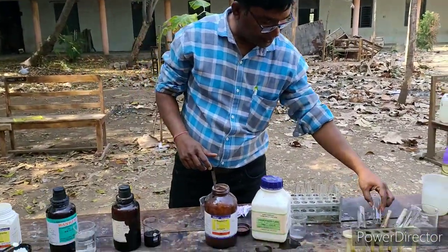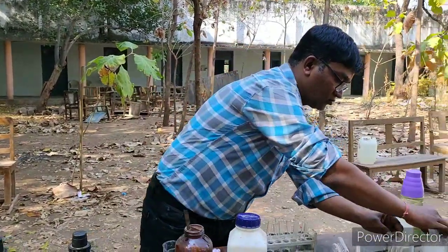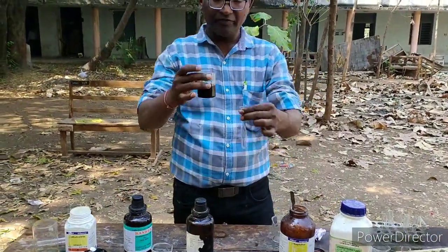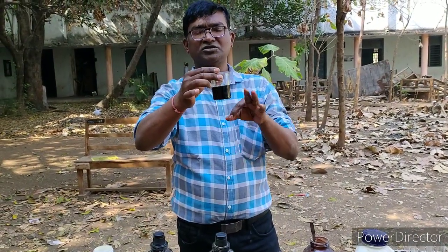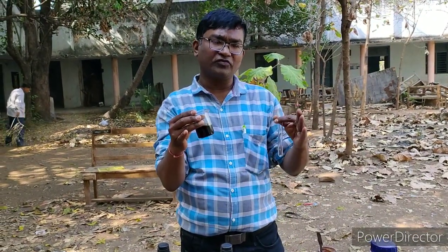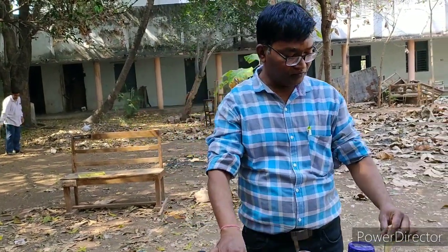In another test tube we take the HCl solution and keep it in ice cold water. Then we take aniline in another test tube. Aniline has no color, but if stored for a long time it undergoes oxidation with aerial oxygen and changes into some oxidized products, becoming black. However, it still contains some amount of aniline, and that portion gives us the required reaction — so there is no need to worry about using slightly oxidized aniline.